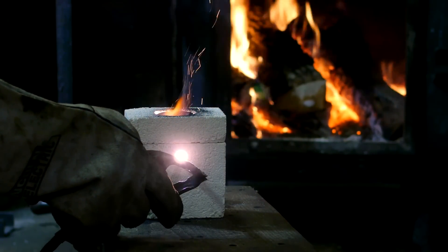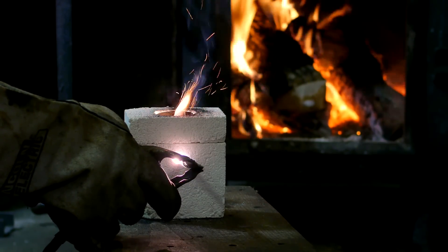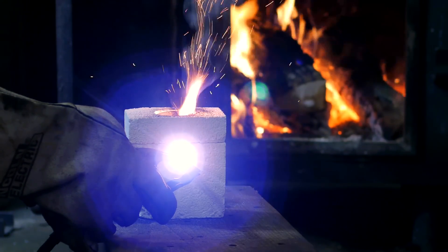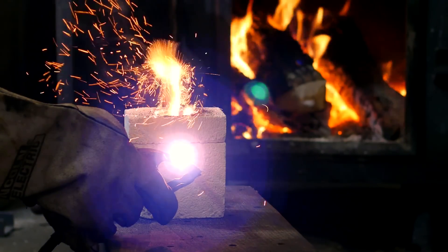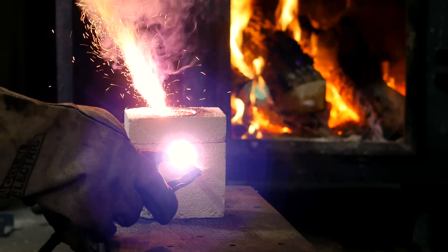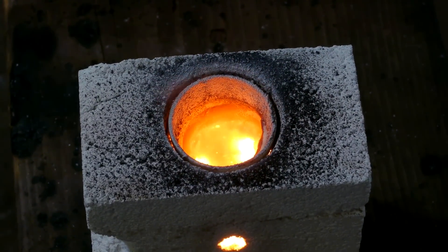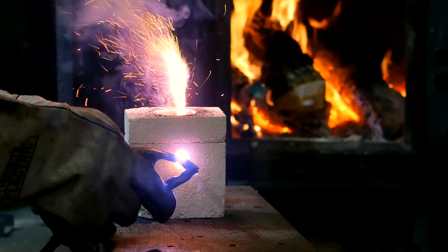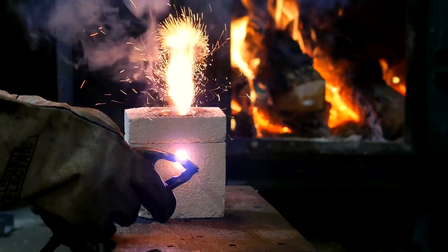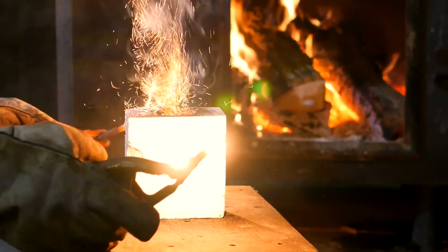This is a clip of my very first attempt — at this point I had no idea whether or not it would work. The first thing that happens is some of the charcoal begins burning in the air. I knew this would happen, which is why I used more charcoal than was necessary. As the crucible heats further, eventually we start to see bright purple plumes coming out of the surface. Even after I take away the heat, you can see that these potassium plumes are still formed for a short while while the reaction vessel remains hot. This is a huge success, and I'm thrilled with this experiment, but there's still a big problem. The reaction is so hot that the potassium metal is formed as a gas, and I need to figure out a way to distill it back into a liquid and then a solid before it burns up in the air.